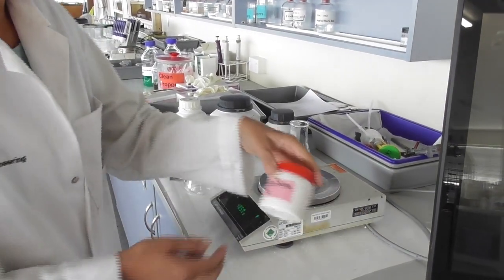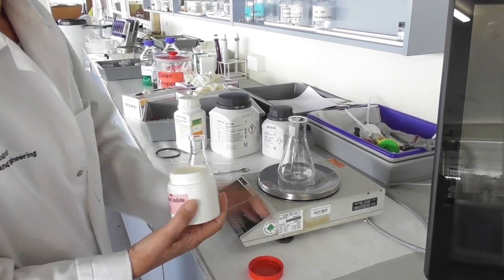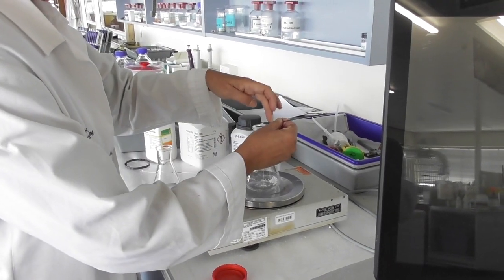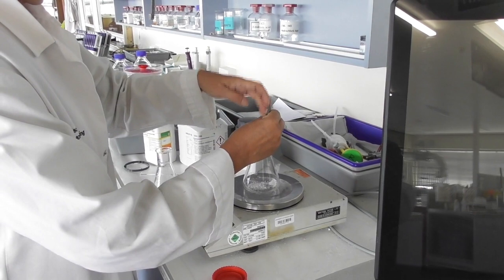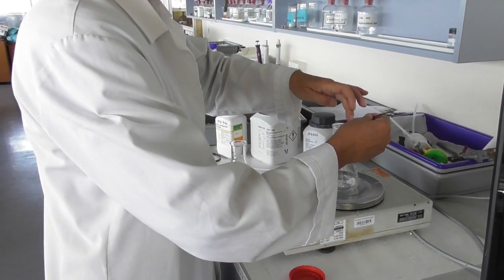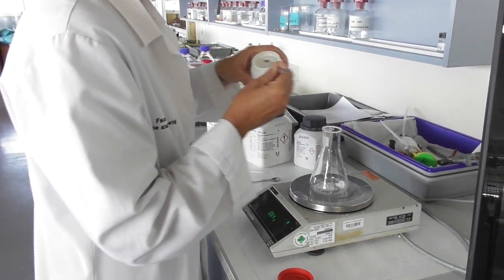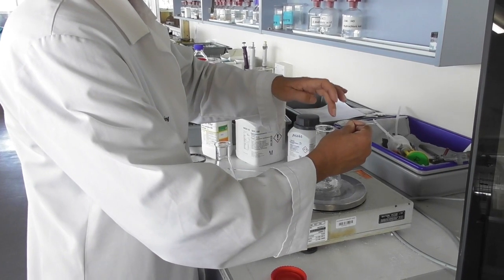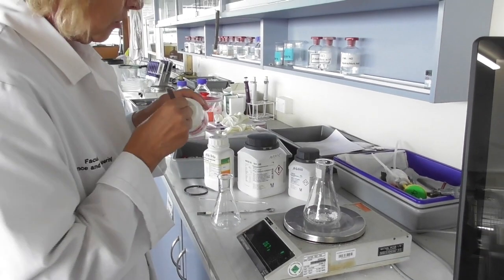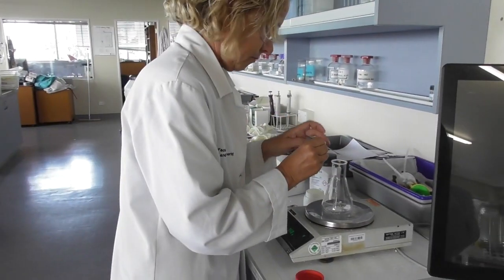The next step is to add potassium iodide to each of the flasks containing the peroxyborate. I need to add about 0.7 grams of potassium iodide into the flask. This doesn't need to be done on an analytical balance as I add the potassium iodide in excess anyway, so approximate masses are fine for this reagent.